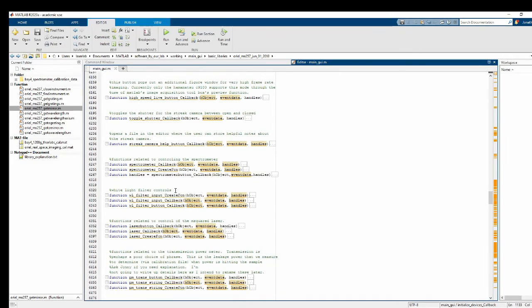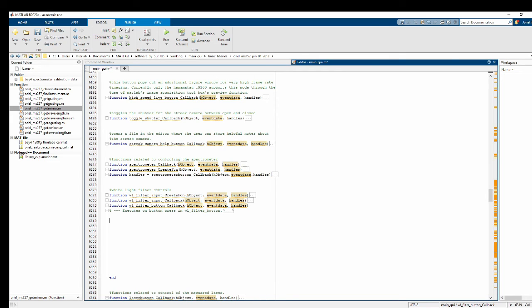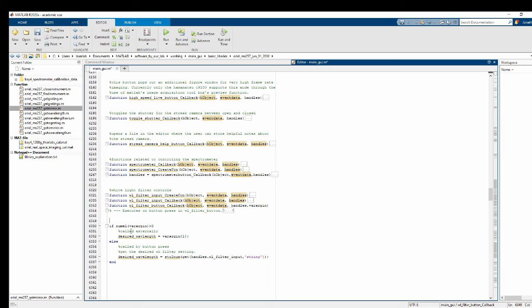So we go down to where I put them here. And this is the code that'll execute if somebody presses that button. And we're actually going to update this a little bit. So currently it's set up to just be a button, but I also want it to be possible to call this function externally. So I'm going to add in a varargin here. And then we're going to do an if statement on that. So if it's called externally, then the input is the desired wavelength. That's going to be used for our step and glue algorithm, things like that. If it's just a button press, varargin will have 0 elements, and so this piece of code will run, and it'll read the string from the input field, and it'll convert it to a number, and we'll have our desired wavelength, whatever the user is requesting.